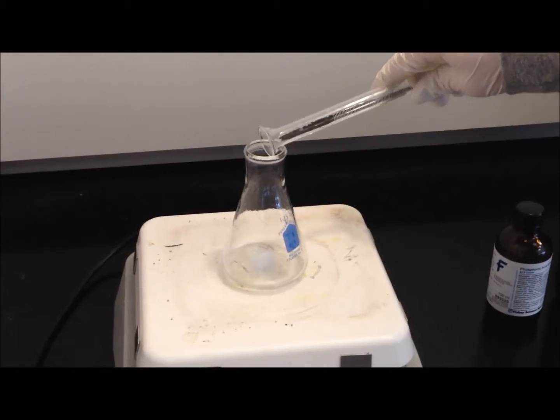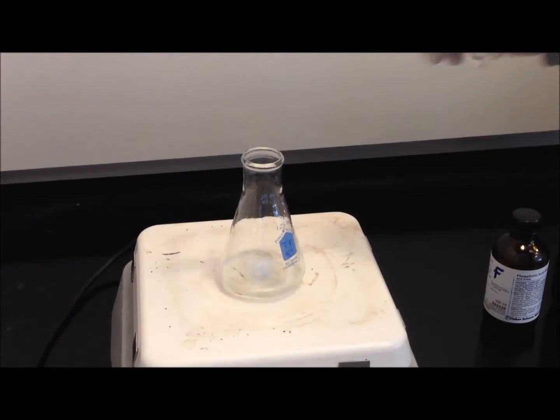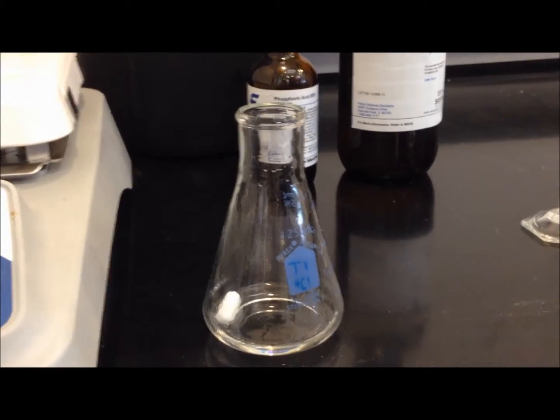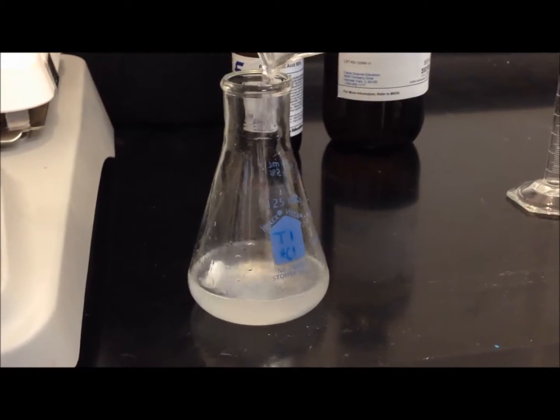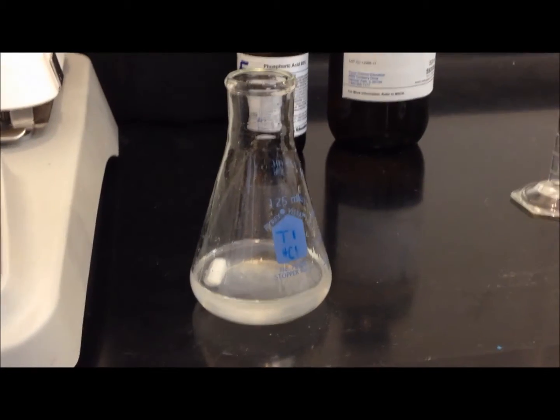After we had been letting the flask sit on the hot plate for about 10 minutes, we then added 2 milliliters of distilled water. After about 15 minutes had passed and the reaction had stopped, we turned off the heat and then allowed the flask to reach room temperature. We then added 20 milliliters of distilled water.